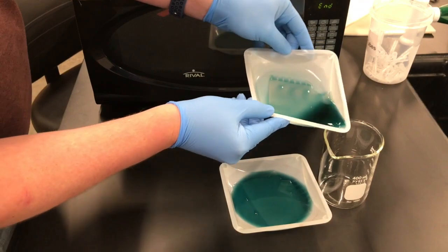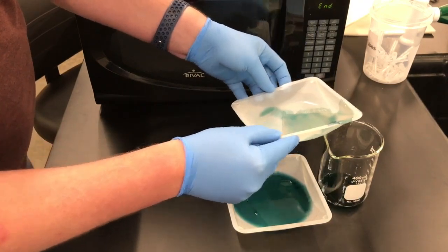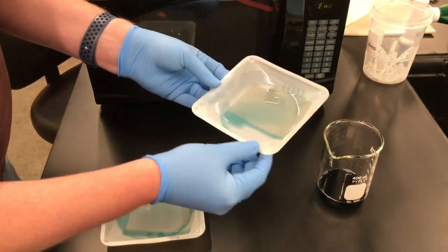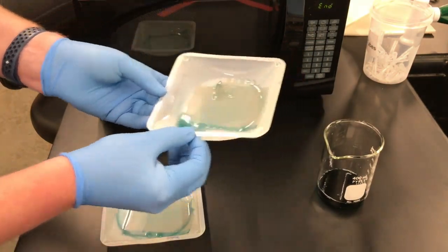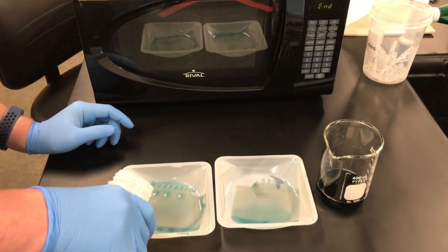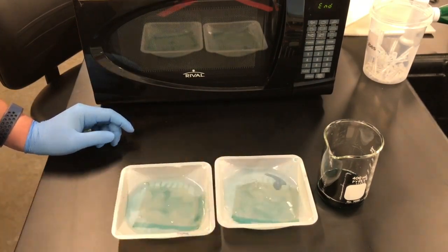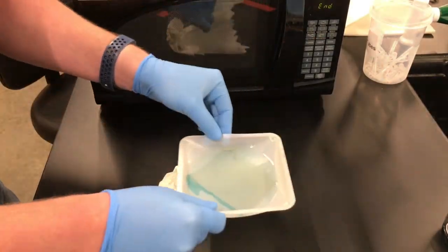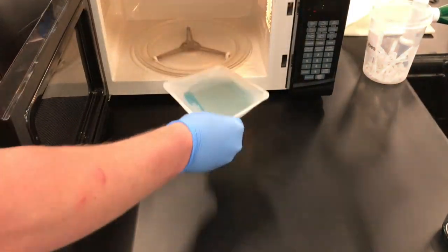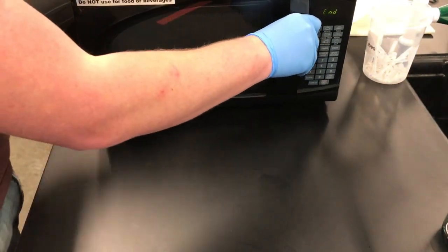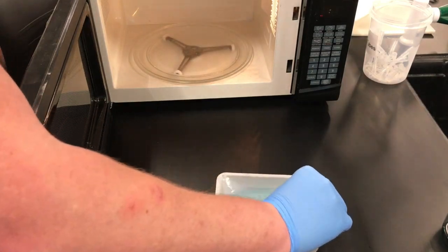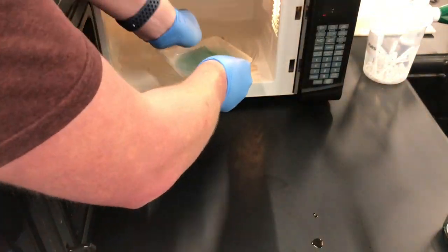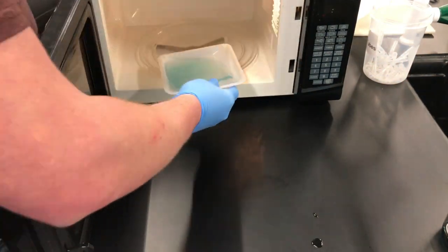After the hour, we go ahead and decant off the liquid into a beaker and rinse these gels with a little bit of deionized water. Now what we need to do here is to destain the gel, and that's to get rid of any color that's in there that isn't actually complexed to the protein. Really the whole gel itself has dye all over it so you cannot really clearly see the bands of the protein. So this destaining process is really important in order to get some better contrast so that the protein bands actually stick out.